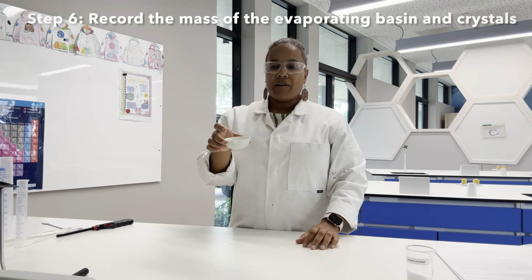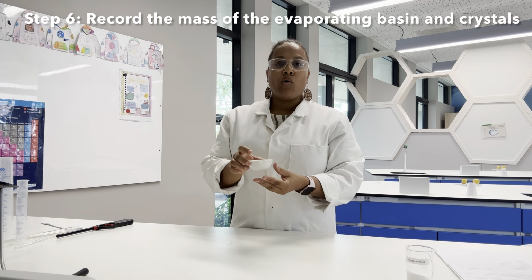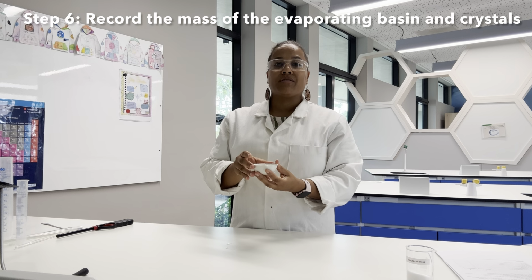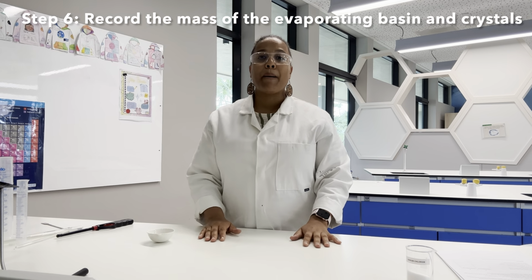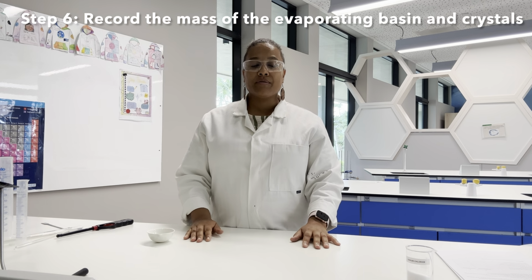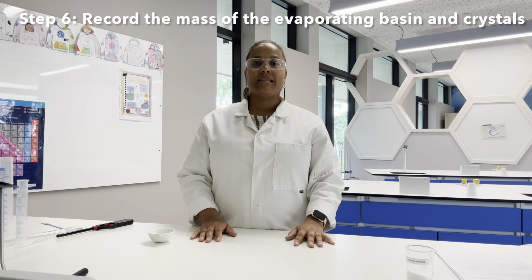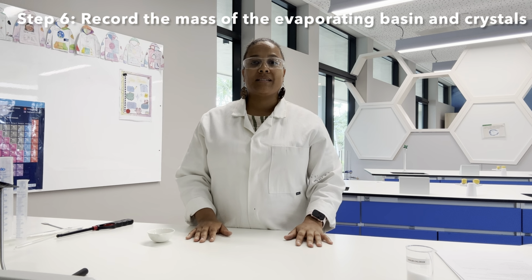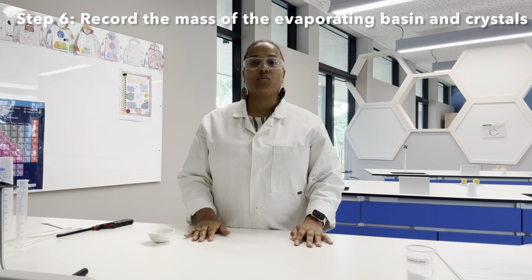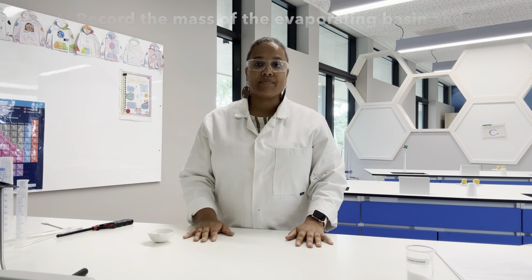Now, I've come back in the morning and I've got my crystals in my evaporating basin. Now what I'm going to do is measure the mass of these crystals, and then I will be able to work out my solubility. So remember, we need to times that mass by 4 because we added 25 grams of water, we didn't add 100 grams. And remember, solubility is grams per 100 grams of water. I will show you in a second how we do the calculations for this.